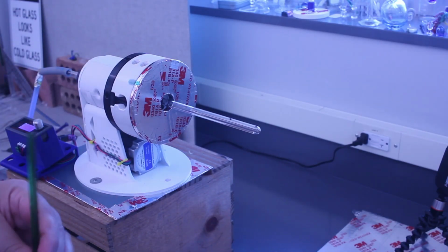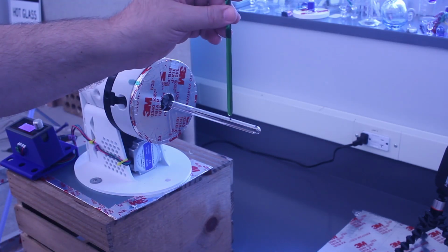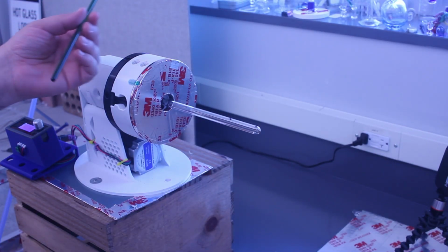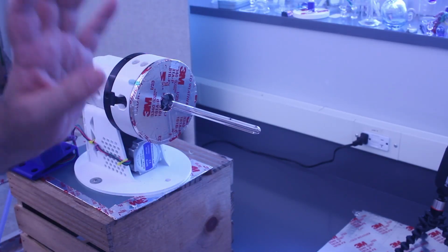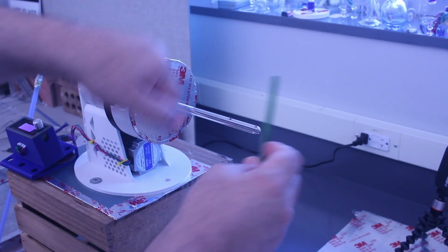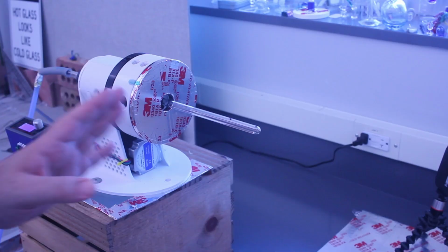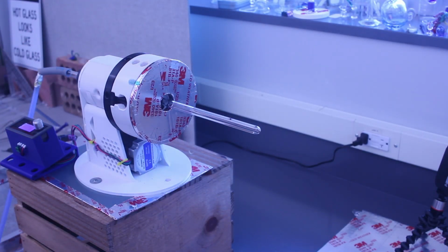Why use the lathe? At the beginning, you can rotate to preheat the glass, and then the lathe will hold the glass tube in position while you finish everything up. So it basically gives you a more stable way to do this. But you can do this exact same technique holding the tube in your hand and holding the rod in your other hand and using a bench burner, or mounting up the tube to a rack and doing it that way. So this is just to demonstrate another technique, but again, using the lathe does have some advantages.